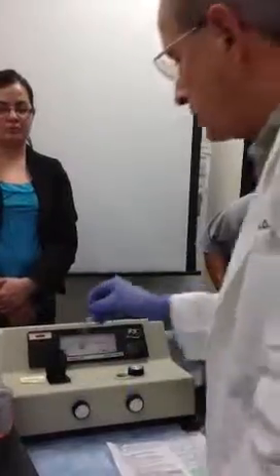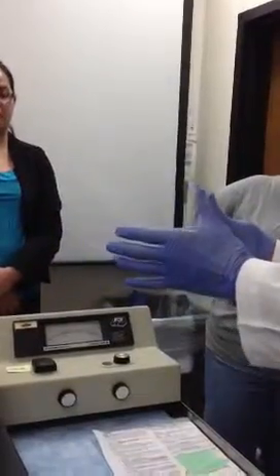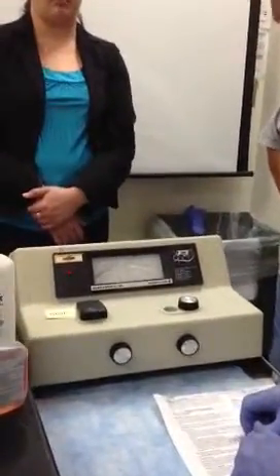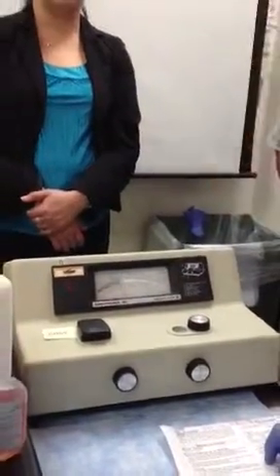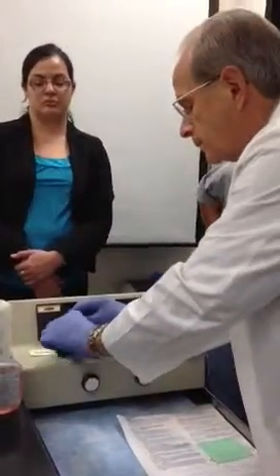Now, what we want to know is how does this thing transmit light? Or what's its optical density? We know it's 200 milligrams per 100 milliliters of cholesterol, but now we're reading 34% transmission of light on the top scale, and down at the bottom we're reading 0.48 absorbance or optical density. Now that's just a raw number, all right? But remember that 0.48. All right?